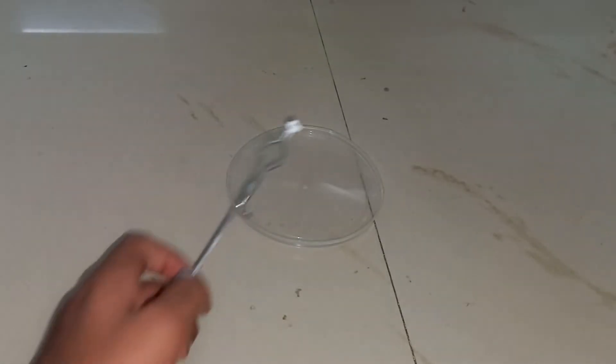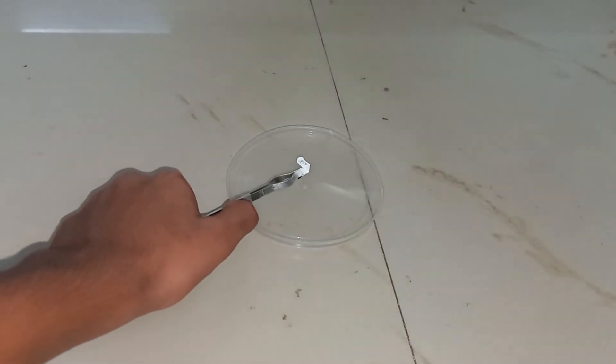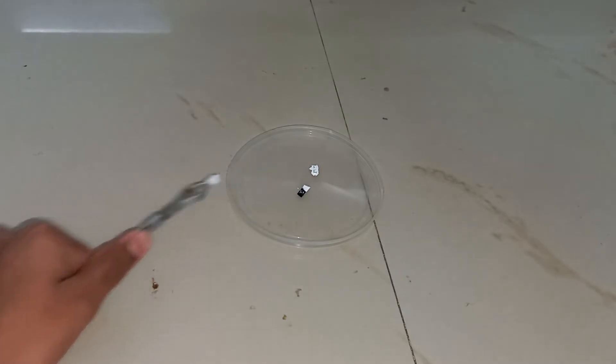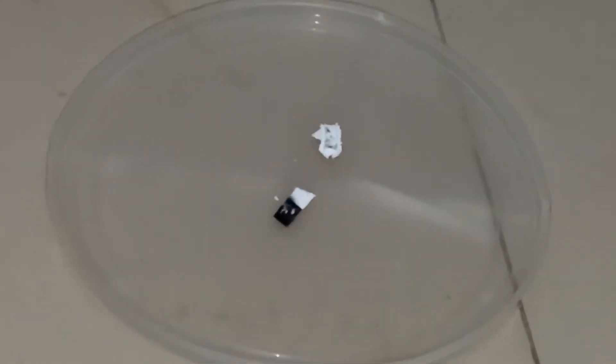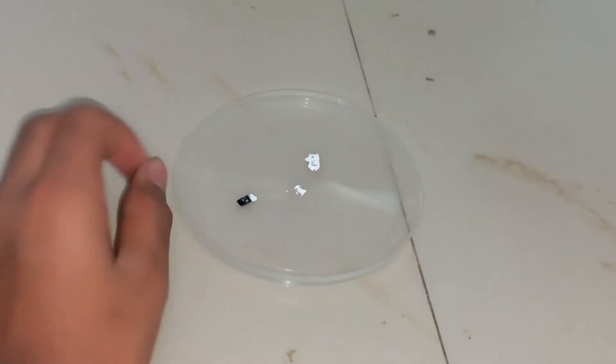So the magnesium oxide I will put it on this cover. You can see the magnesium oxide right there. So this is the magnesium oxide. I will add some water to it so that I can see the reaction.